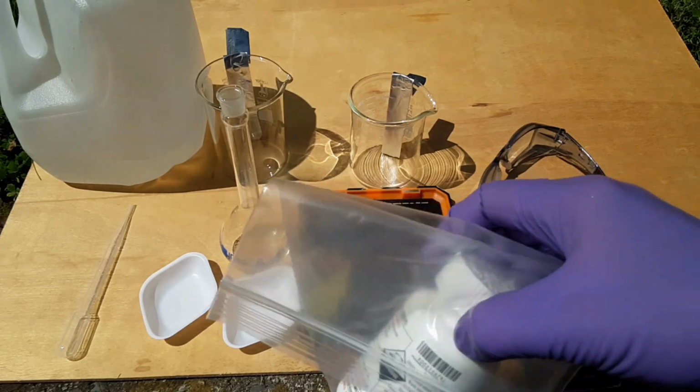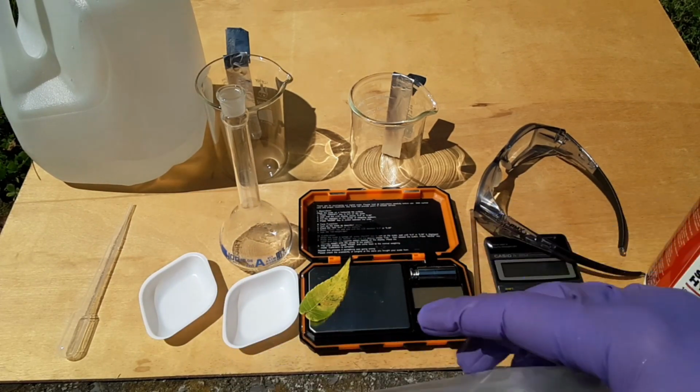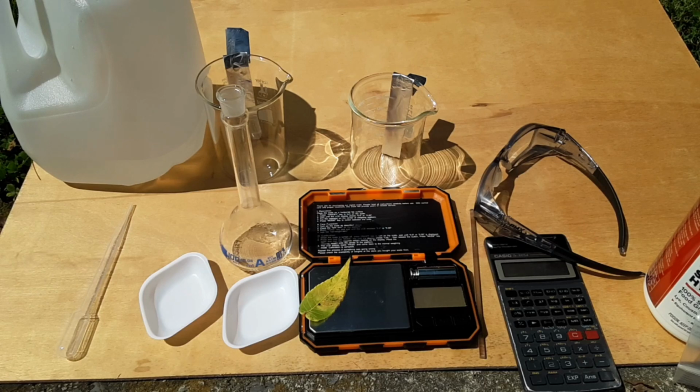Today I'm going to be looking at potassium hydroxide and sodium hydroxide to see what the difference is in the reaction with aluminum. When I did a little bit of digging on this, as always when you go to the internet, I got not really conflicting, but depending upon where I looked I got different information, so in all fairness I can't really make too many statements about this because I'm not sure.